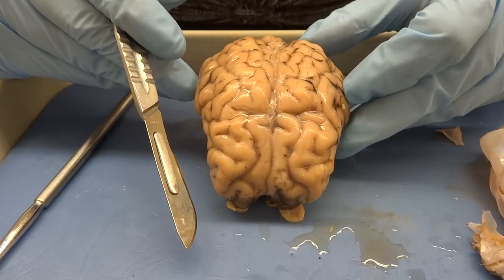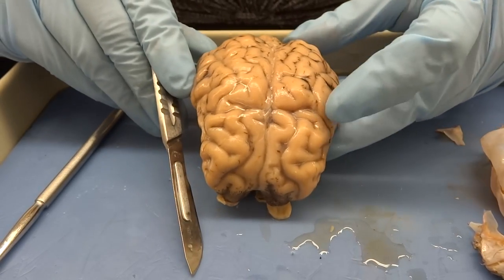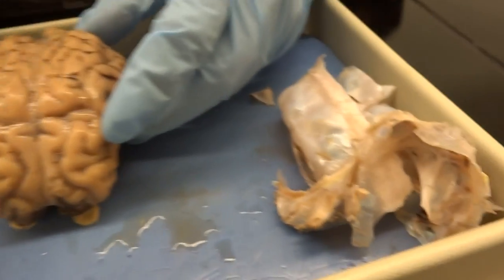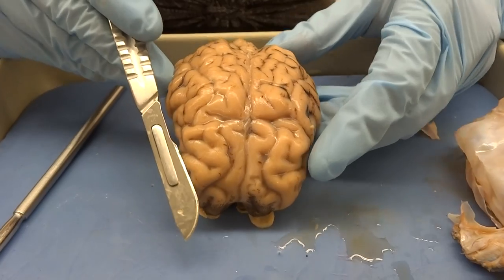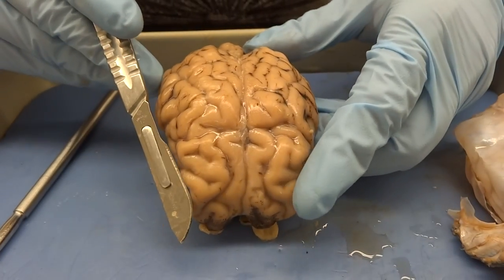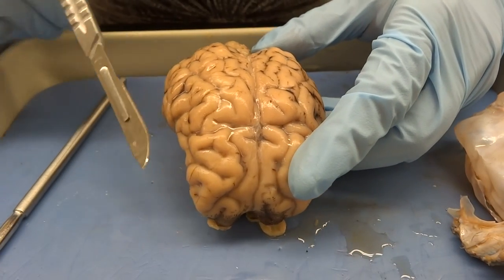Looks like you've been hard at work there, Karine. I have. I took off all of the dura mater, which you can see a pile of right there. And if you do this kind of carefully — here are some tips and guidelines on what I did.